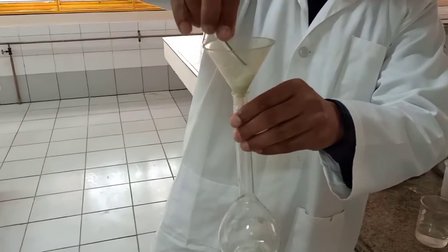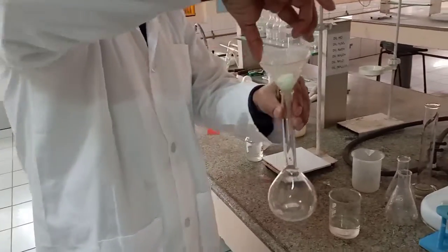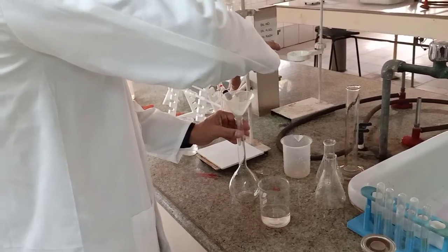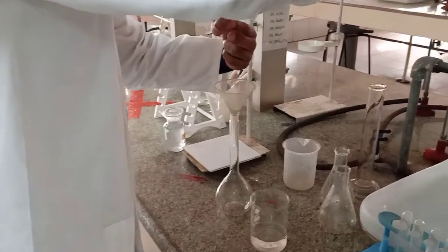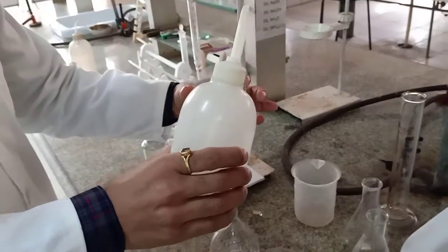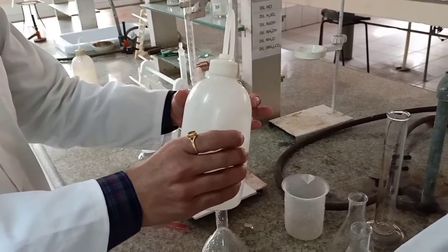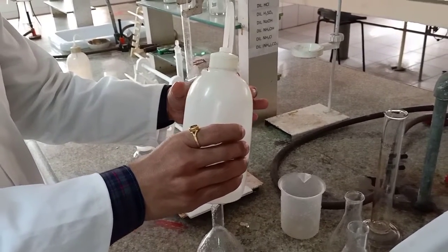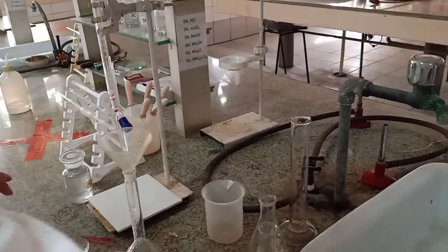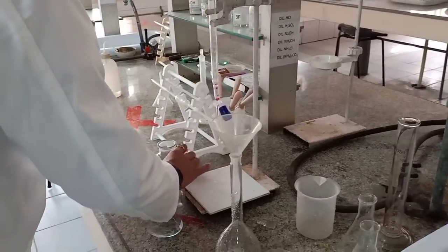This is how we transfer it. But you understand, while transferring, some amount of salt may be left on this watch glass. So what we do is, I'm just trying to ensure that you watch it carefully. I just add a little amount of water, only a little amount of water. And immediately I add one test tube full. This is the test tube. I'll take one test tube full of 4N H2SO4.